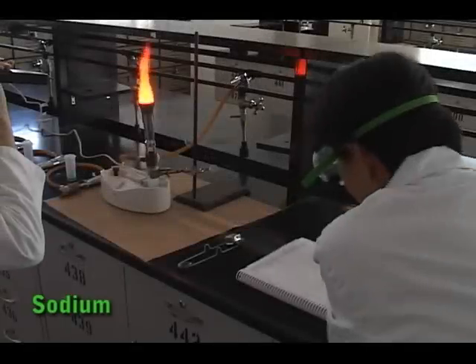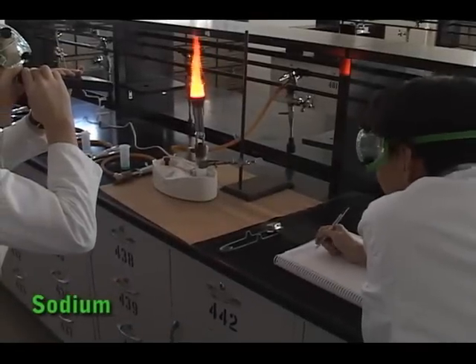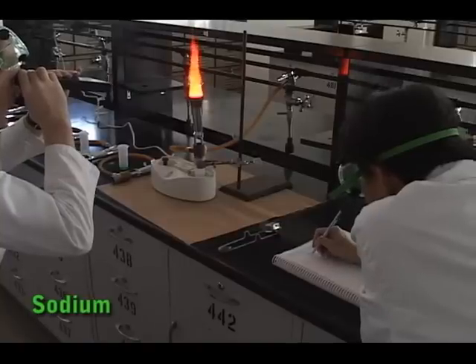To view the emission spectrum of ions, your TA will burn some substances over a flame for a short time. Make sure to know when this is happening so you don't miss your chance to observe this spectrum. In addition to recording the spectrum of the flame, also record the color visible to your eye. This will aid in unknown identification later.